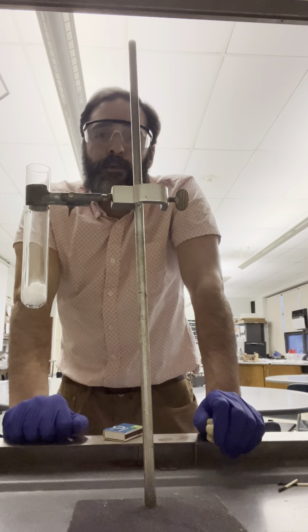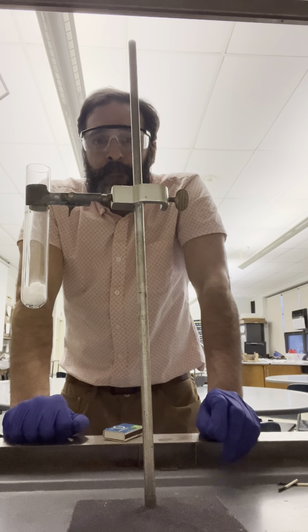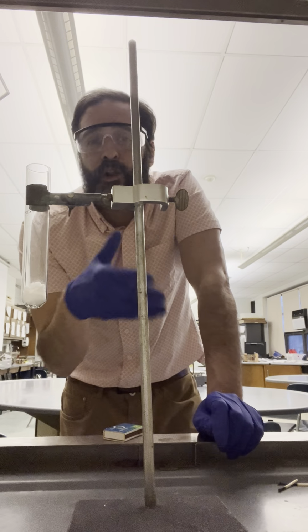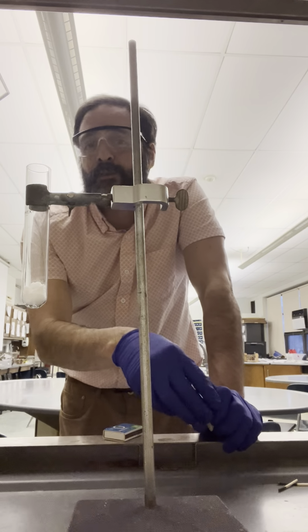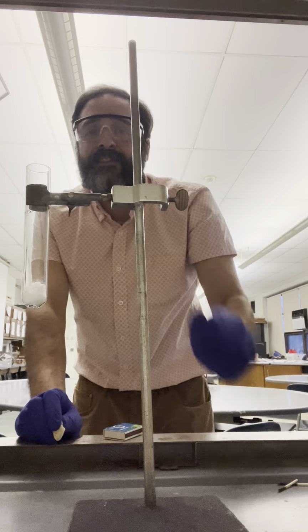Oxygen is the second most reactive element, period. And because of that, it reacts with things very strongly. So when we create in this test tube an environment that is well over 20% oxygen, and the oxygen is a little bit hot because the chemical was hot, it's going to react with the sugar very, very quickly. It's actually going to explode in basically a fireball.